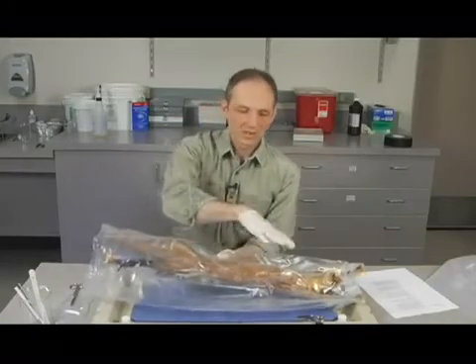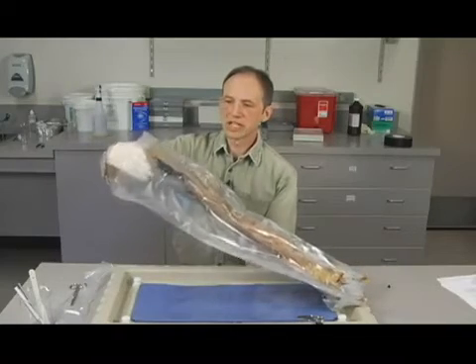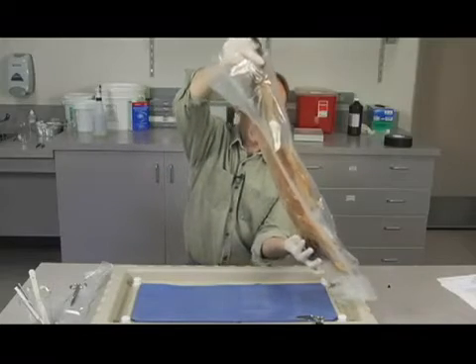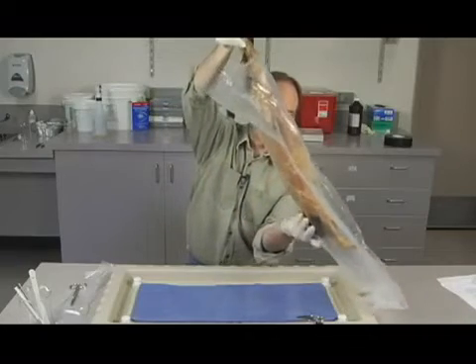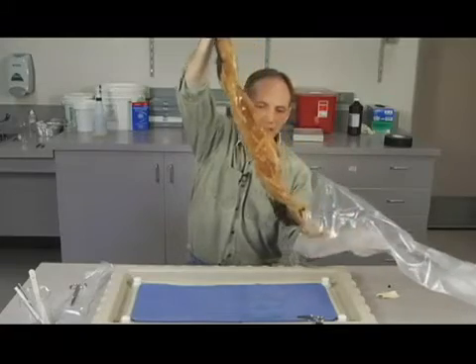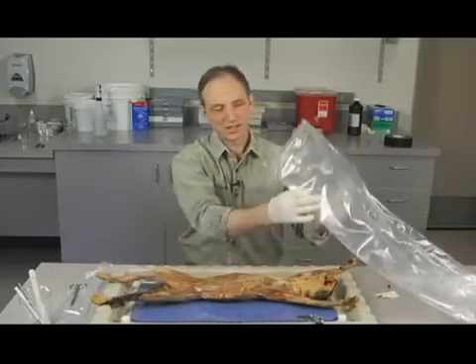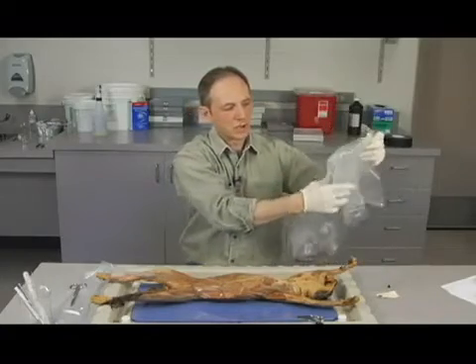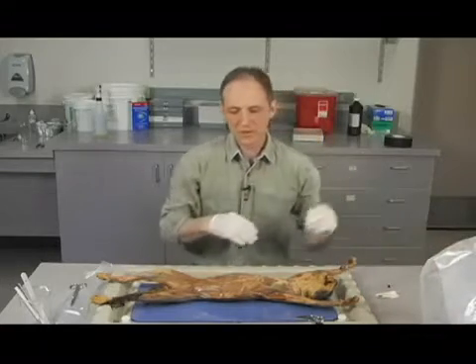So now we've opened it up, exposed the cat to the air, and the best way to do this, since you've got a tray here, is to make sure that you hold the cat over the tray and pull it at an angle like this. I've just put my hands in here and grabbed the feet. I'm going to let it out slowly. I don't know if you can see this or not, but there's some fluid accumulating at the bottom of the bag, and I'm letting that happen as I pull the cat out. Just going to continue to do that, and there we go. I've got it on the tray there. That wasn't so bad. I'm going to fold this bag over, and we want it to sit upright so that it doesn't spill all over the place.